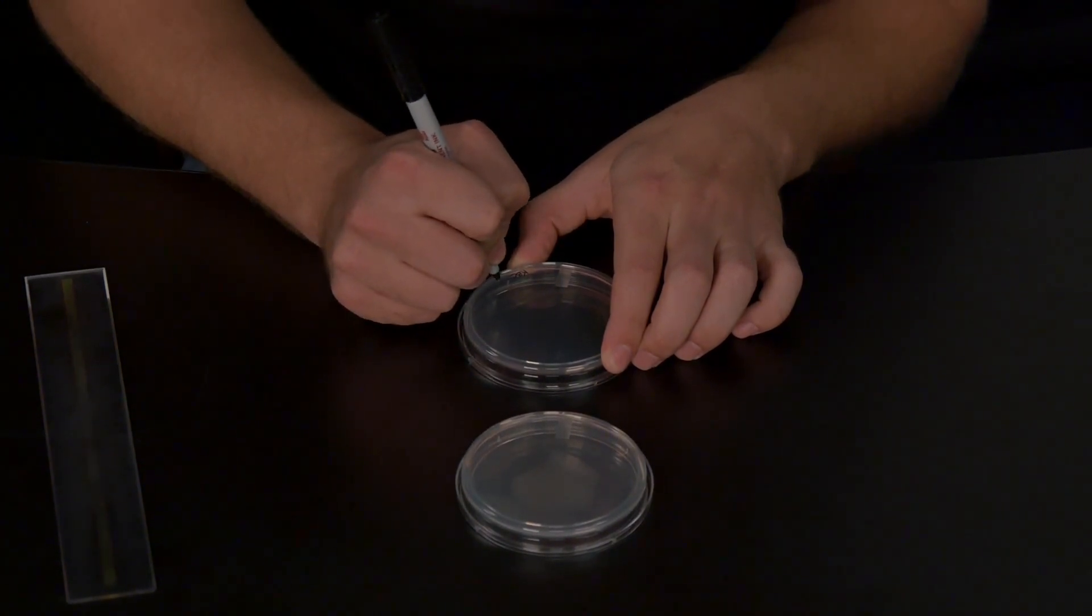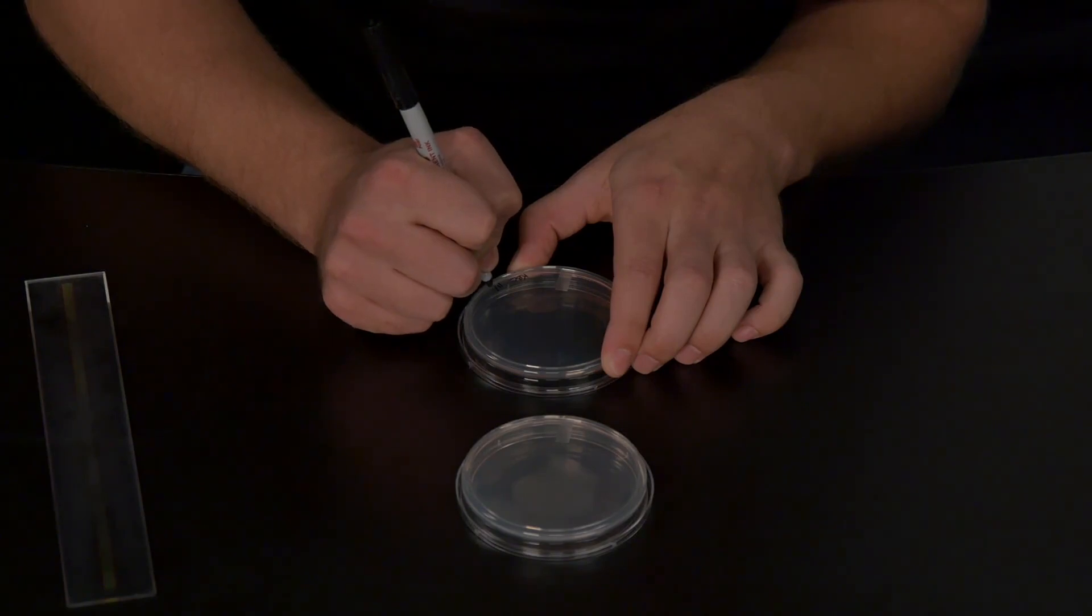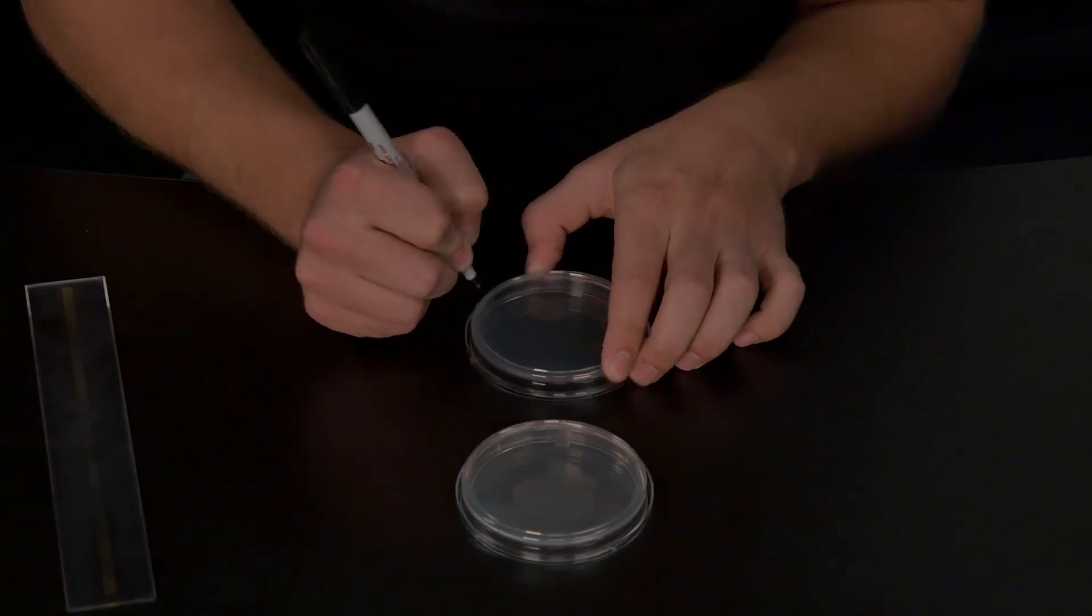Write your name, the date, the media type, and the temperature of incubation on the bottom of the plate.